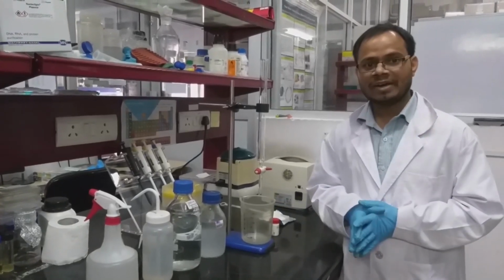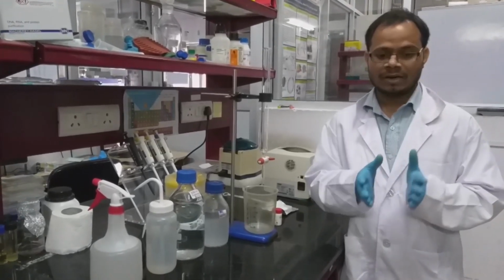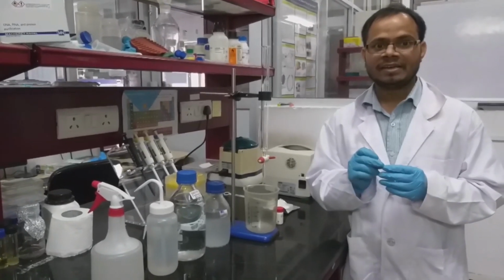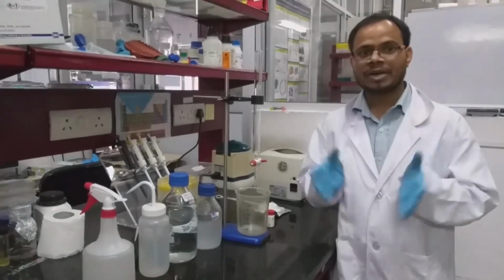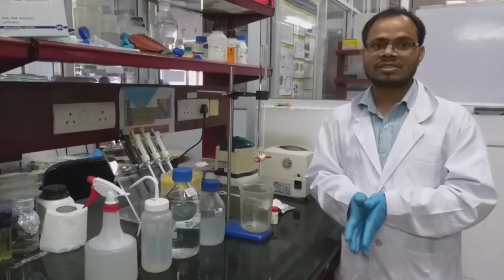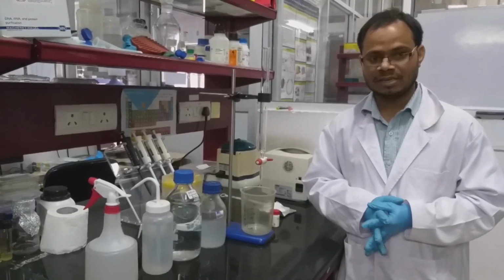This matrix contains beads which have small pores. If you want to separate a mixture of molecules starting from 1 kDa to, suppose, 200 kDa, the small molecule of 1 kDa will permeate or diffuse into the pores in the beads, and the bigger molecule of 200 kDa will be excluded from the pores. So it will elute first, and the smaller molecule will be retained, and we have to give sufficient buffer to elute that one. So this is the overall concept of gel filtration chromatography.